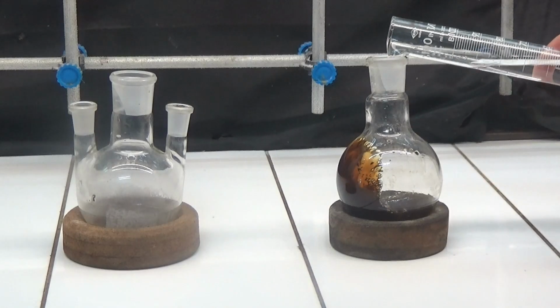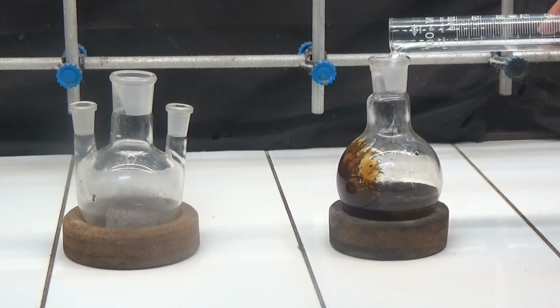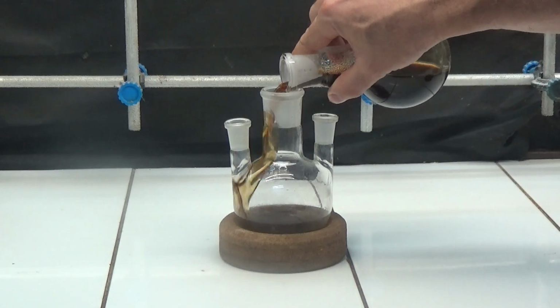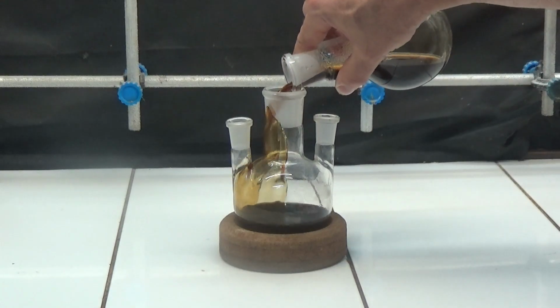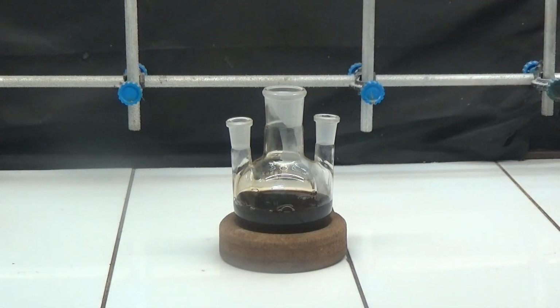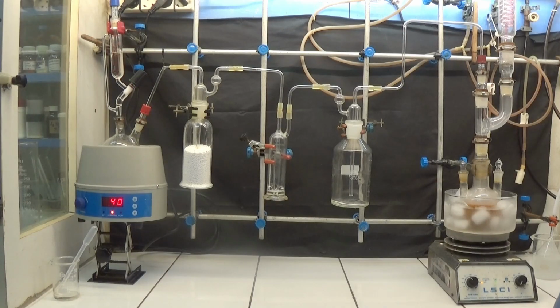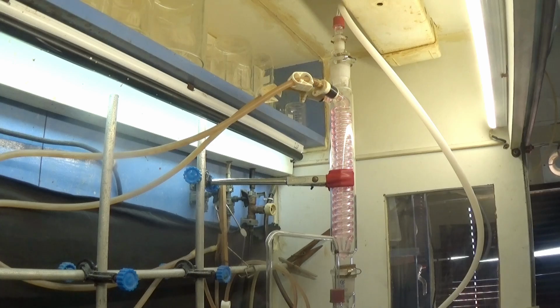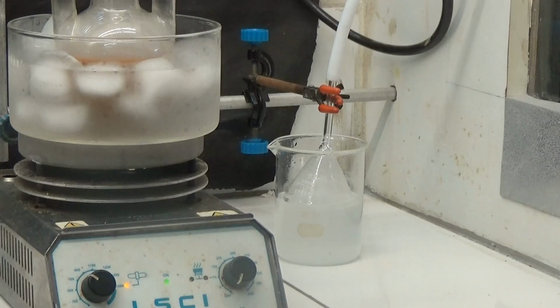The next step is to decompose the obtained sodium salt into methyl acetoacetate. The obtained mass is diluted with 3 parts of 50 ml of methanol and transferred to a flask with 3 openings. One of the openings will be used to collect samples to check the pH. Set up a hydrogen chloride generator with drying traps to obtain a gas as dry as possible. Cool in a water and ice bath and pass dry hydrogen chloride through the methanol and sodium salt solution with stirring.